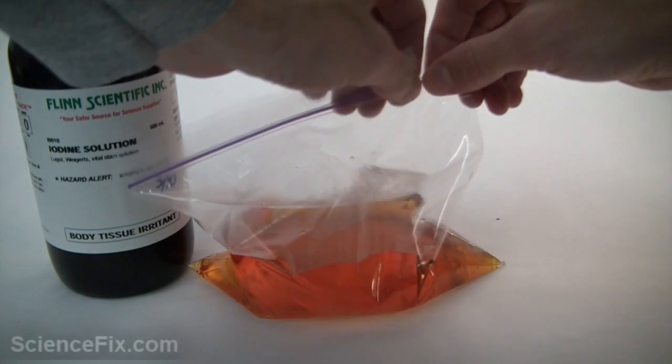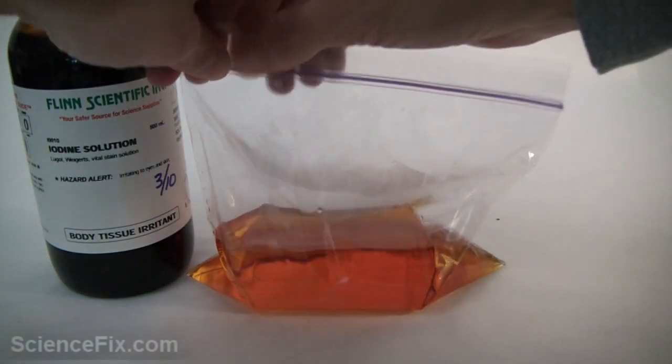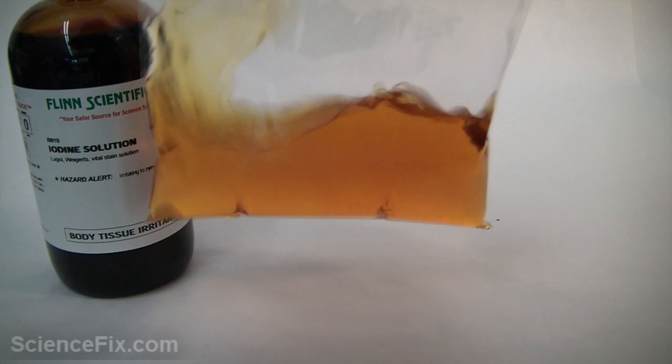Now we are going to place the whole bag into a beaker of that starch water that we made earlier.